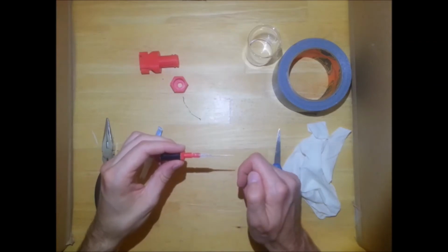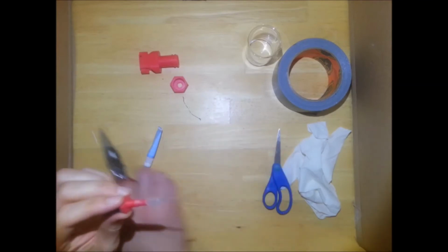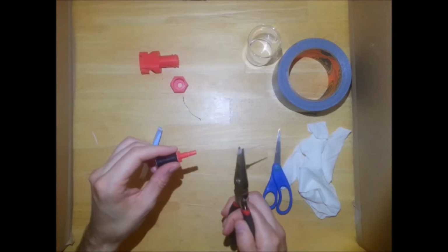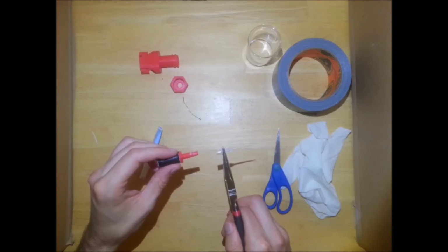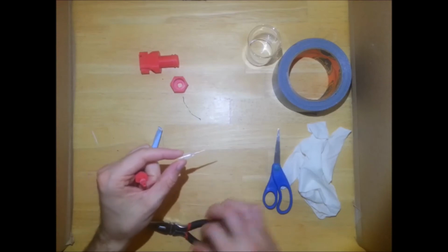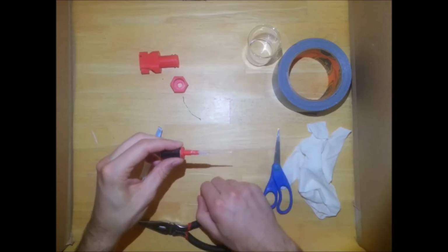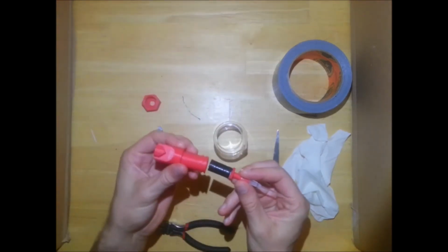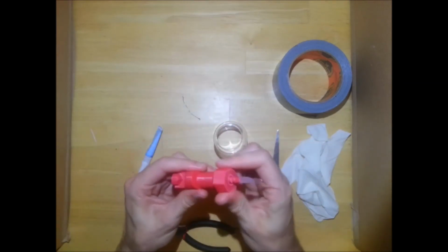I usually let them set overnight, and afterwards you can just take a pair of pliers and twist off the pipette head, even without damaging the pipette tip. And this will create a near perfect friction seal between your pipette head and your pipette tip, and will allow you to have a good airtight connection between any other pipette tips you use in the future. This whole assembly with the tape should fit inside of the head case and should be contained by the head case fastener.